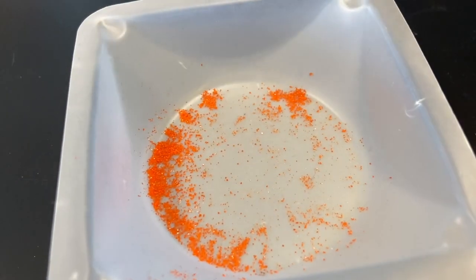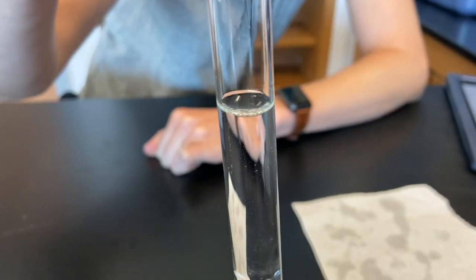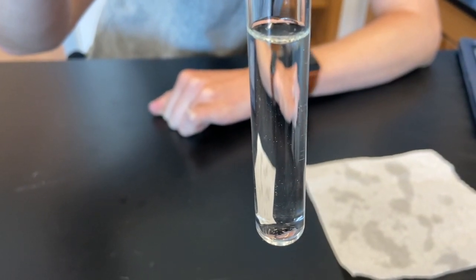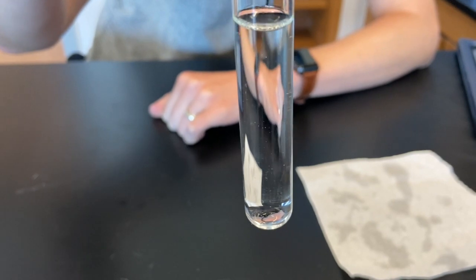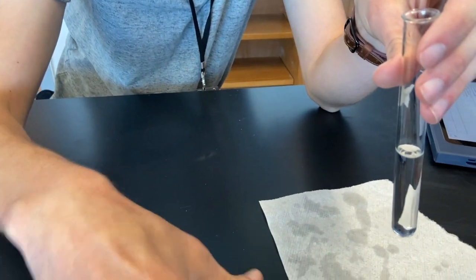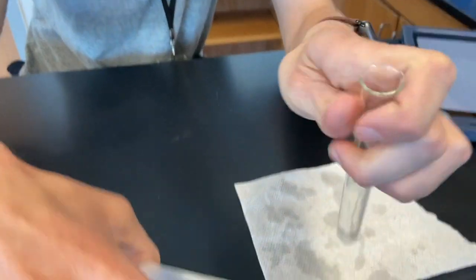And then here's the other substance. This is water — familiar, hopefully. So we're supposed to put a few crystals into the water and observe what occurs. So here we go.